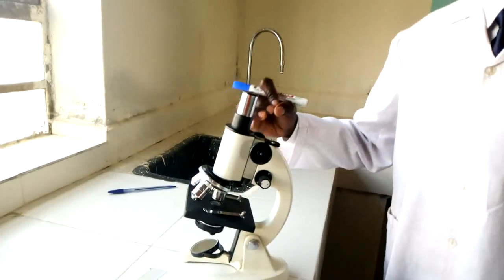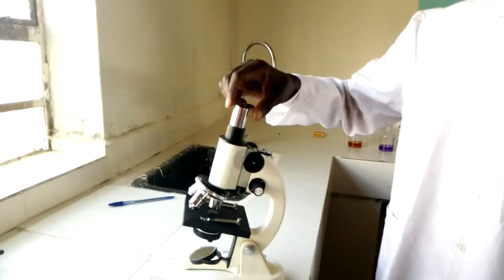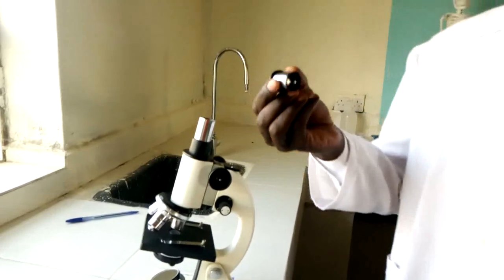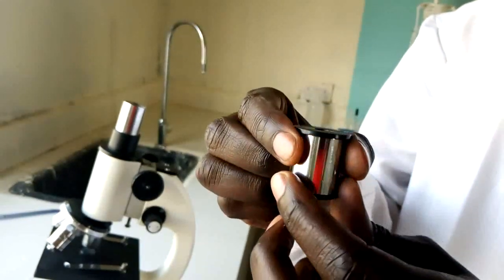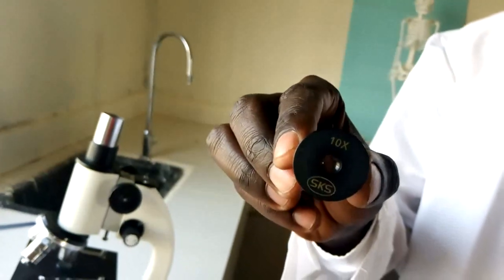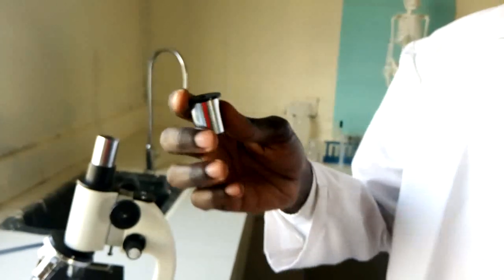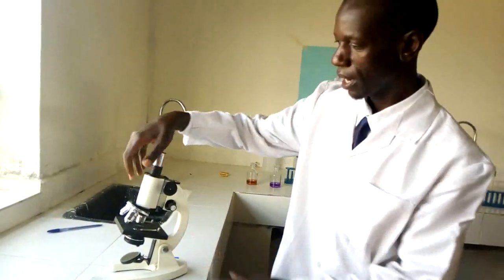Each part has its role to play during magnification of specimens. This part here is called the eyepiece lens. The eyepiece lens comprises some lenses inside it, and it indicates the number of times it will magnify the specimen. The function of the eyepiece lens is to magnify the specimen — the lenses in there magnify the specimen so it will be viewed as a large image.